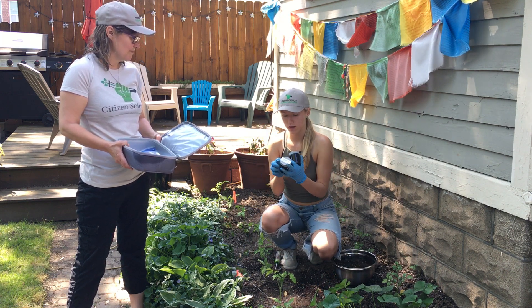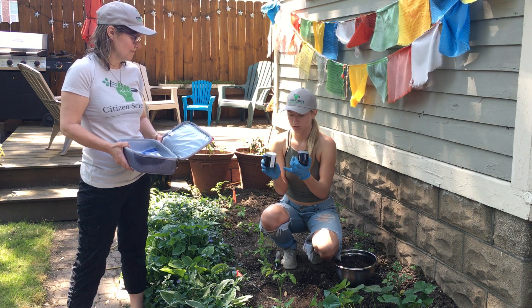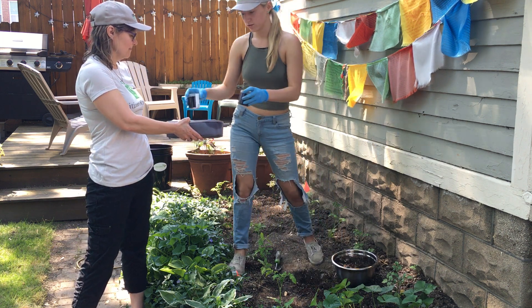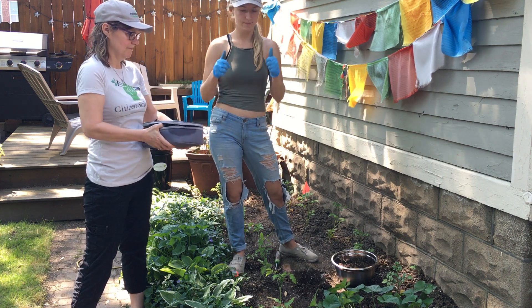Once you do that, close it up. You'll receive a label on your clipboard that comes in the toolkit — make sure it is placed over both sides of the jar. Then put it into the cooler with the bag of ice and send it off to the lab.